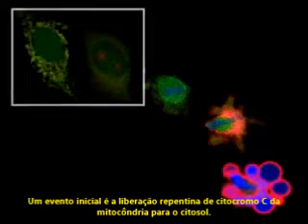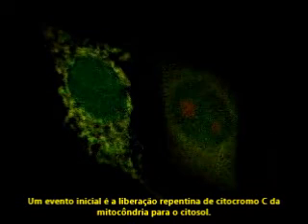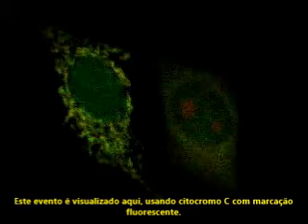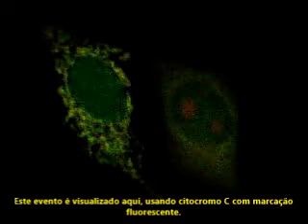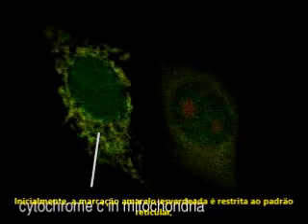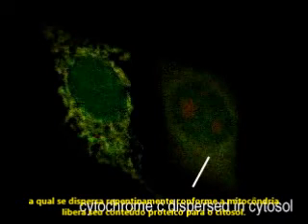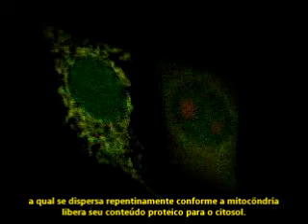One initial event is the sudden release of cytochrome C from mitochondria into the cytosol. This event has been visualized here using fluorescently labeled cytochrome C. Initially, the greenish-yellow staining is restricted to a reticular pattern, which then suddenly disperses as the mitochondria release their content proteins into the cytosol.